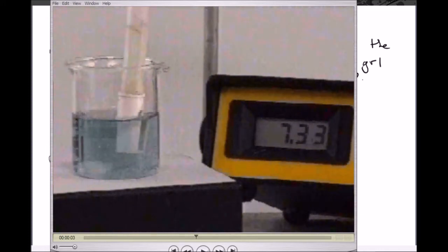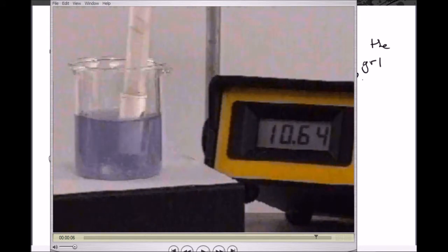So that rather annoying noise in the background there is just a little stir, you can see it there at the end of my cursor, just a little stir in the beaker, a magnetic stir. So you should have one observation already there. You should have now your second observation, fairly significant.